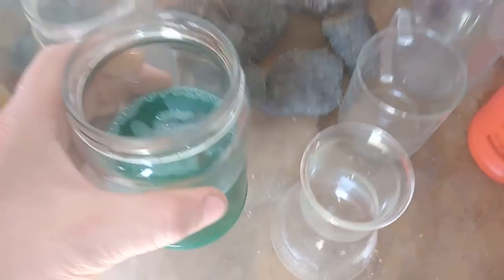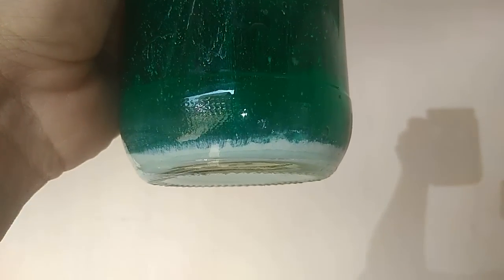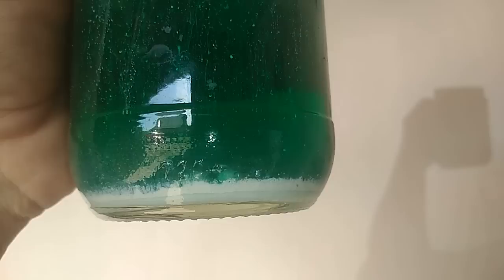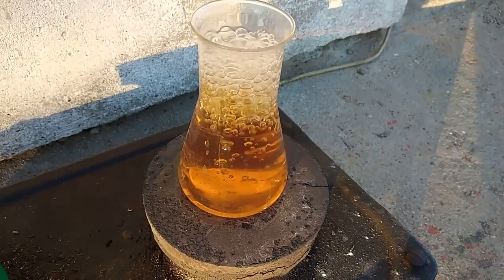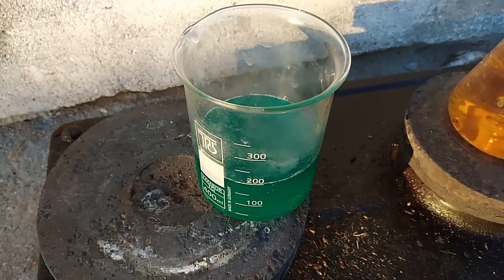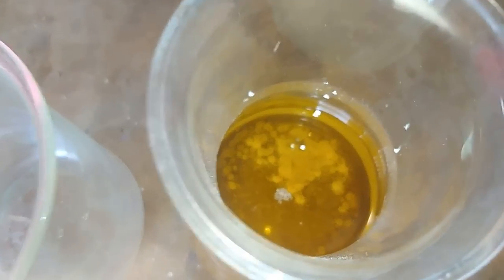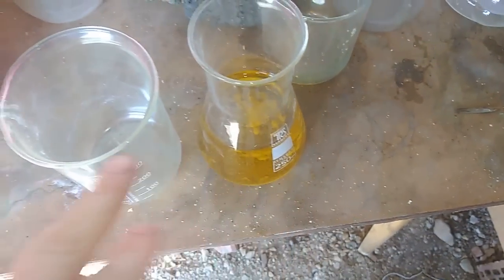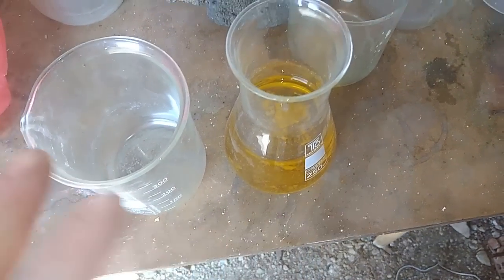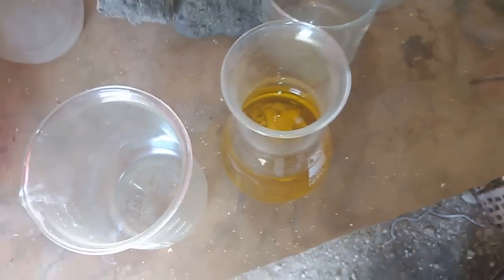This is our silver chloride on the bottom. I will decant that, filter it, and put the solution on evaporation. I vapored one part of the solution and I can see some crystals inside - I'm not sure what those crystals are. I will decant the solution into this beaker and continue with the evaporation step, adding a little hydrochloric acid bit by bit.